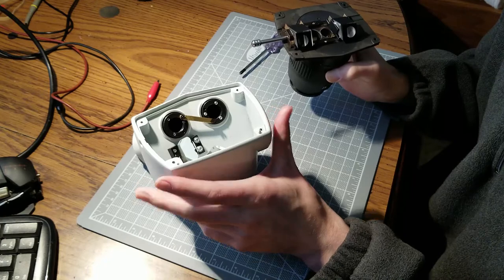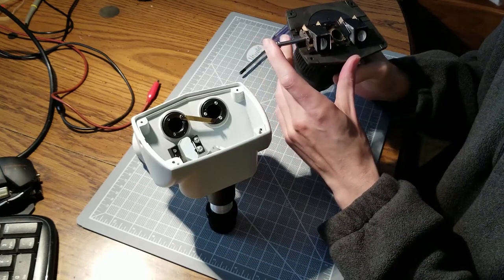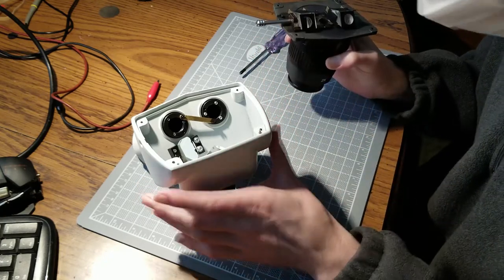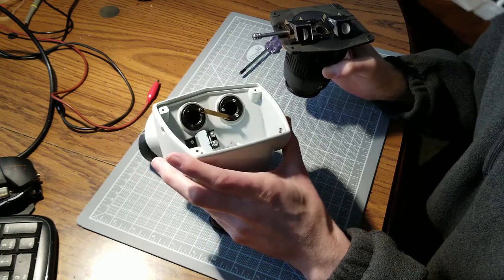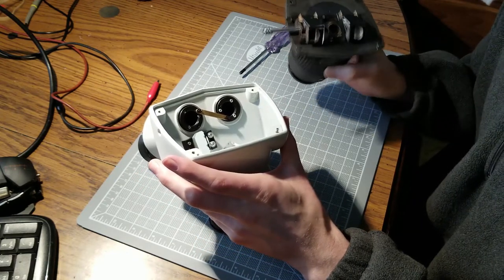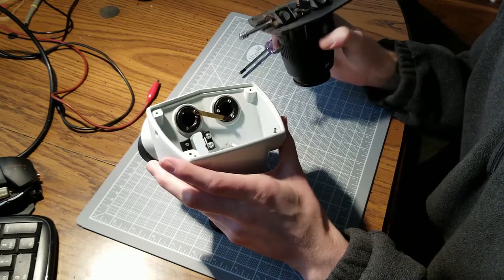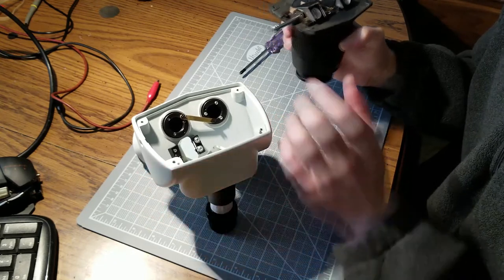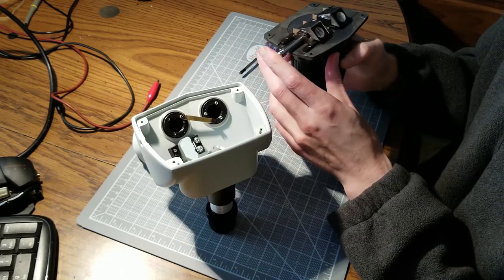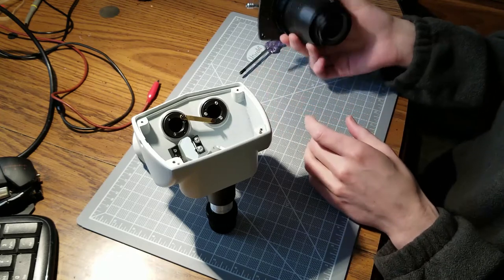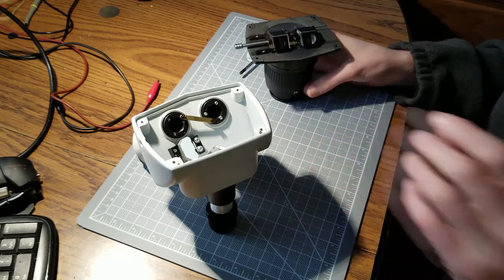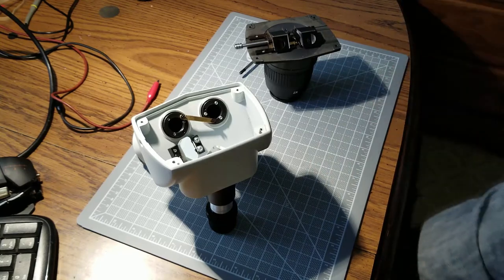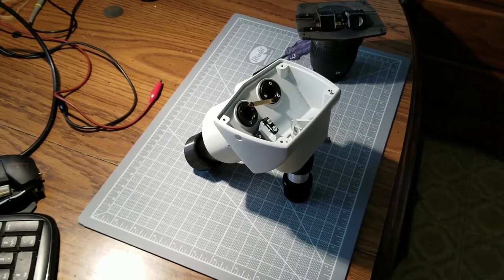So this isn't what I had hoped. I was hoping there would just be a shutter and they would manufacture the trinocular scopes and just put a shutter and have a higher price point for the trinocular scopes and just charge less for the binocular ones and sell them at a reduced cost.